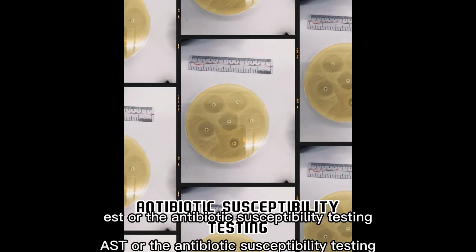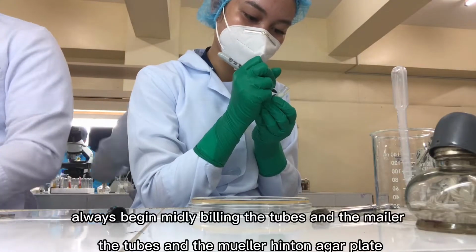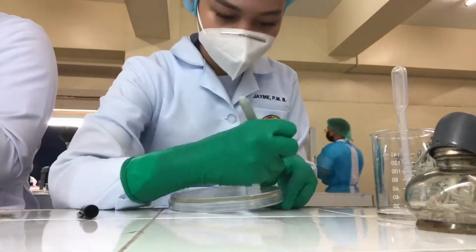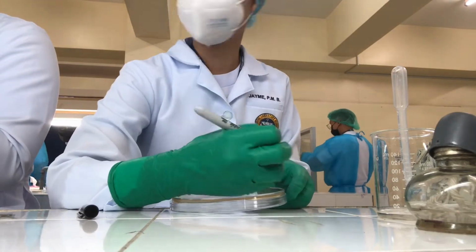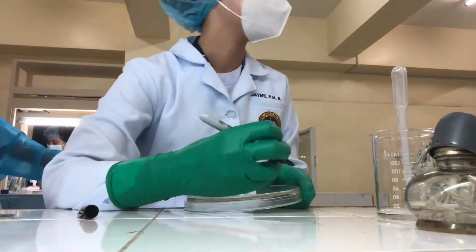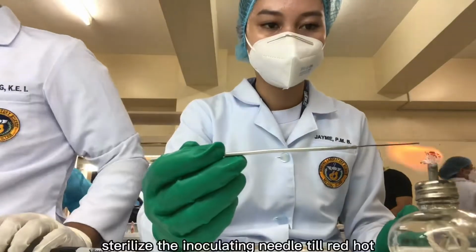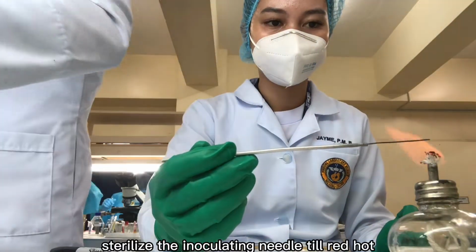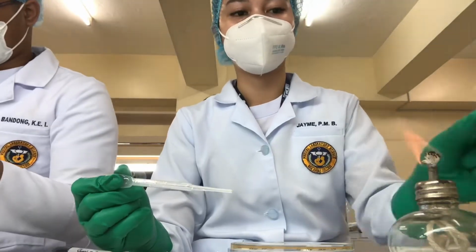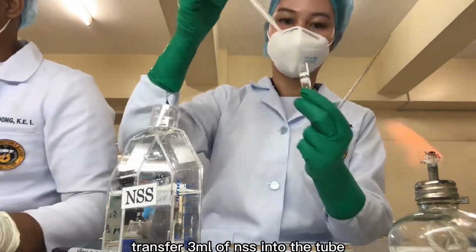AST, or the antibiotic susceptibility testing. Prior to the procedure, always begin with labeling the tubes and the Mueller-Hinton agar plate. Sterilize the inoculating needle till red hot. Using a sterile dropper, transfer 3 ml of NSS into the tube.